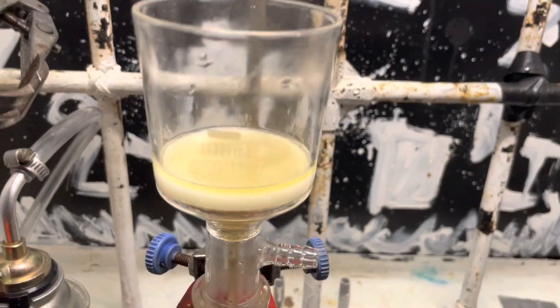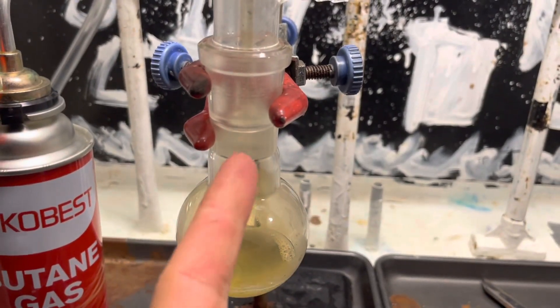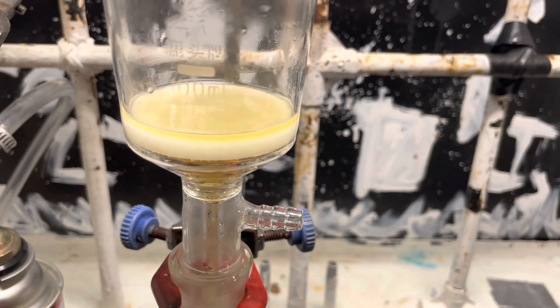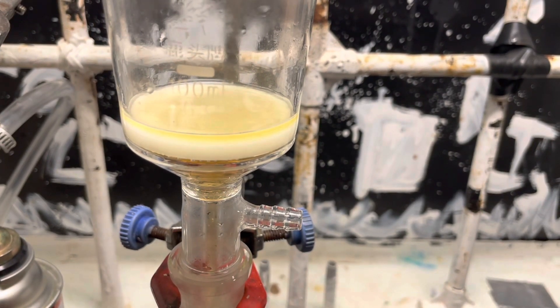If you want to know how to get rid of nylon powder, add fuming nitric acid to our funnel, or piranha solution. Or, apparently, boiling formic acid. Or solution of calcium chloride and methanol. That also apparently works.